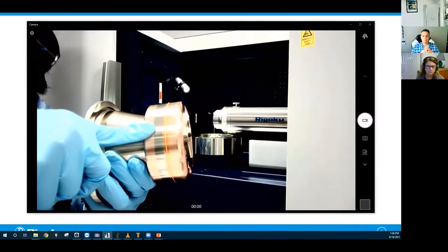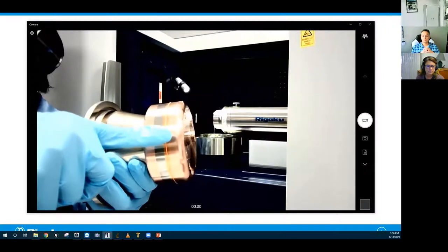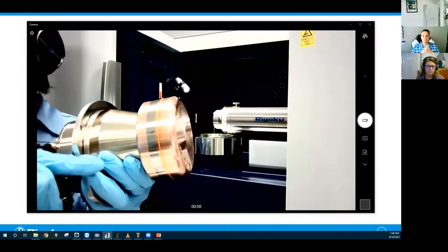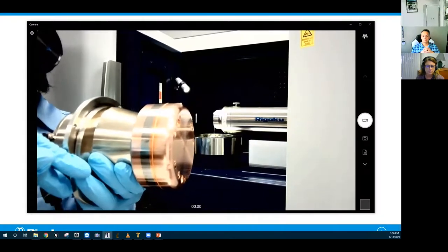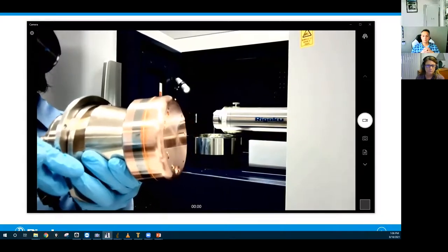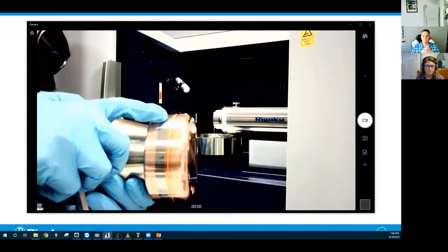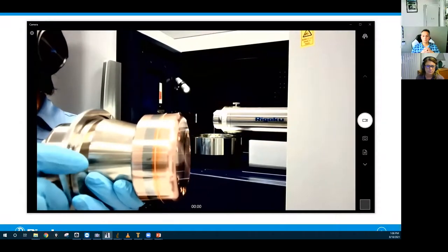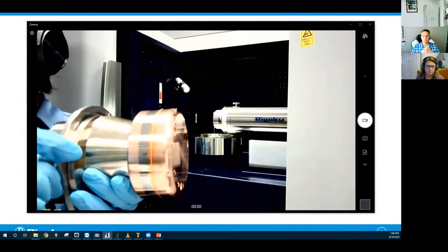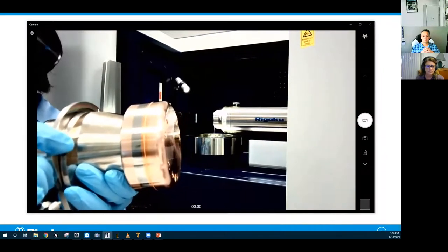And this cup is rotating at 6,000 RPM. So that when the electron hits this target at a high power, it's not gonna melt the copper. And it's being cooled by water from the behind of the anode. And this kind of belt looking thing that you see, the different color from the copper, on this anode, that is tungsten. It could be chromium or it could be molybdenum, something other than copper.